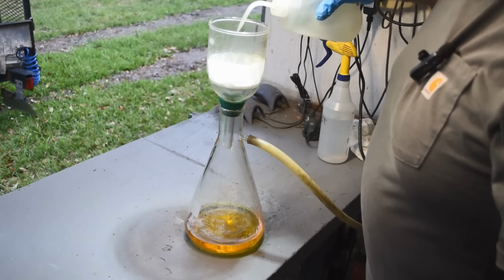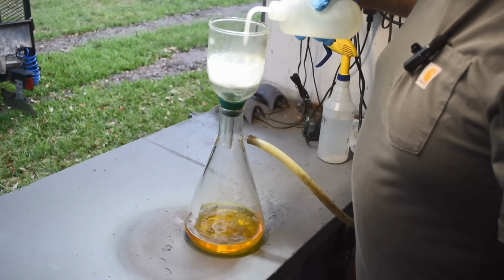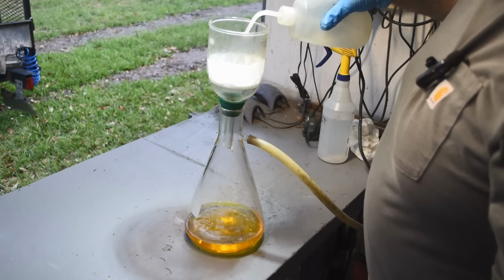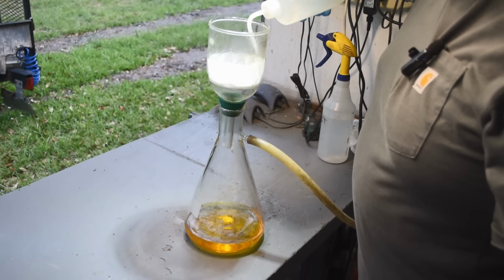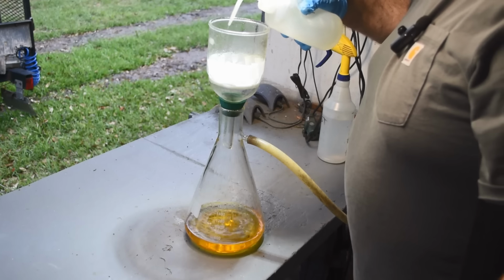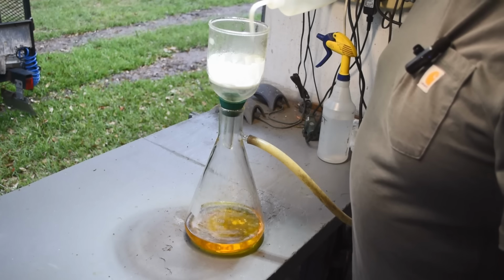Then I'll give you a look in the funnel here at how clean the filter is. We definitely dissolved everything except for a little bit of debris. What it is, I don't know, but it ain't gold because it didn't dissolve in aqua regia.